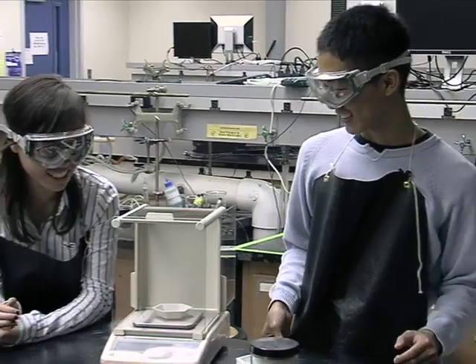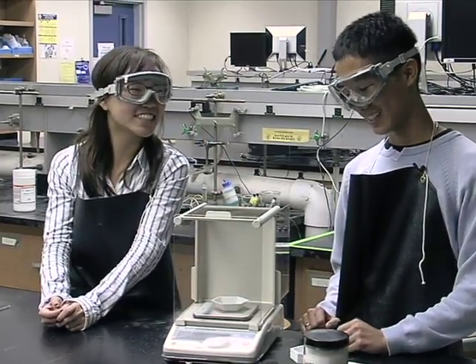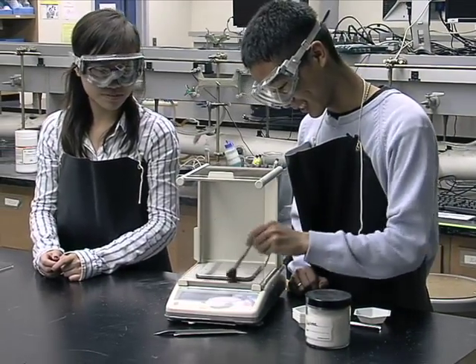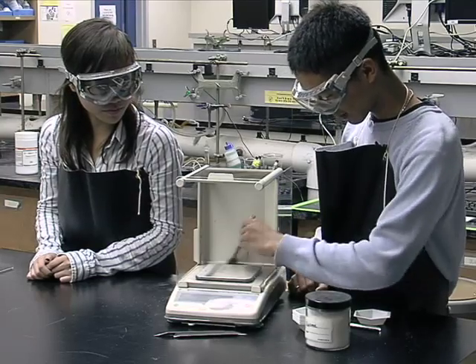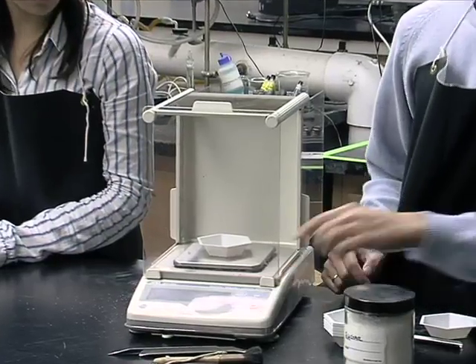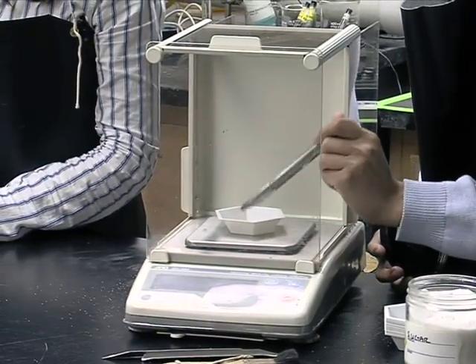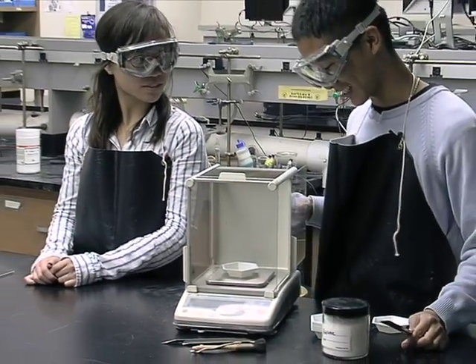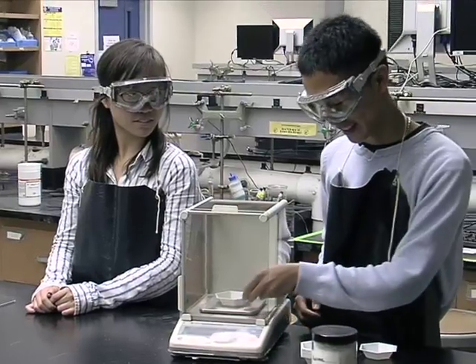Oh, I'm so sorry. I forgot to close the doors. Could you do it again? All right. I'm going to take this out, clean off the sugar with the brush, get another tray, tare it, close the scale doors. All right, exactly .500 grams. The perfect amount for the perfect girl.